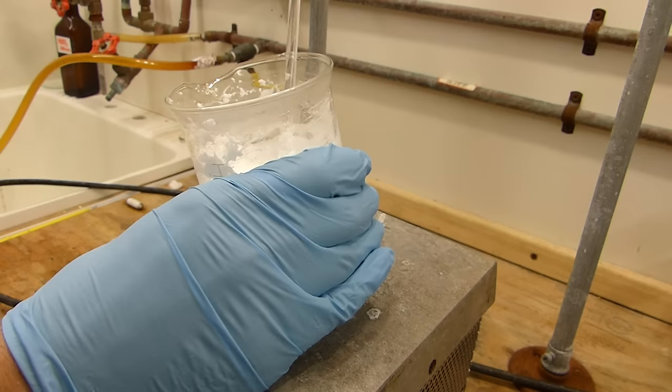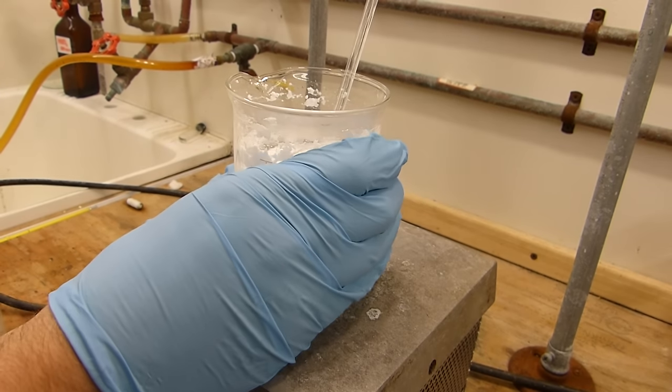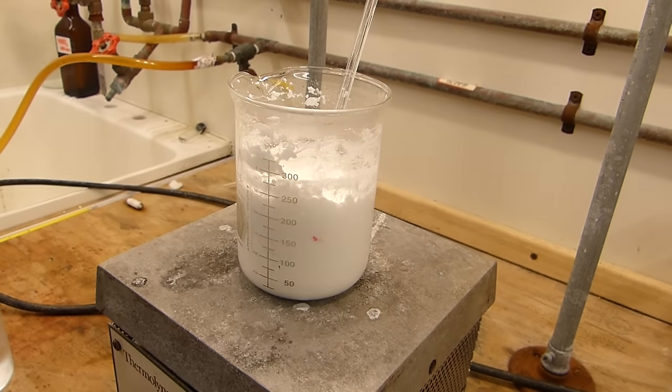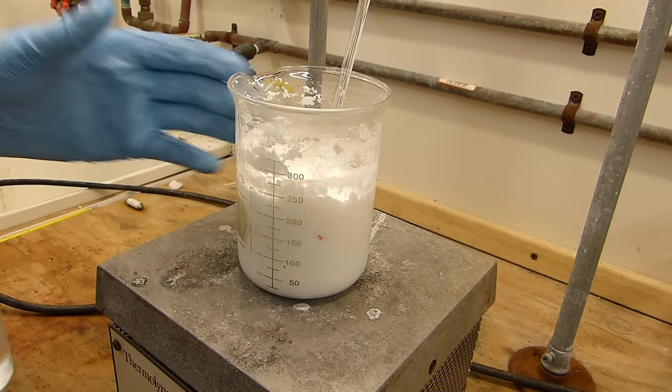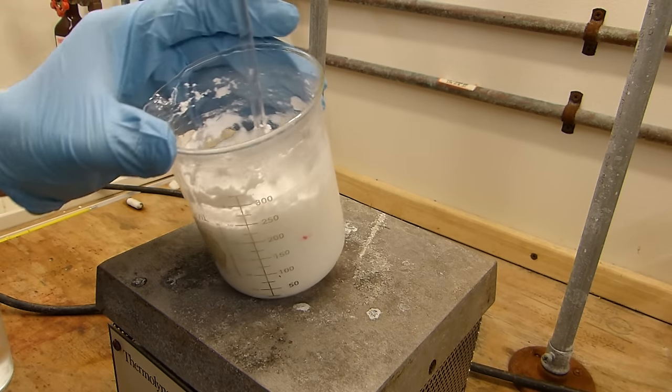Okay, so this is a little warm. I'm going to let it cool out a little bit to just about room temperature, and then I'll go ahead and vacuum filter this to recover the benzoic acid.